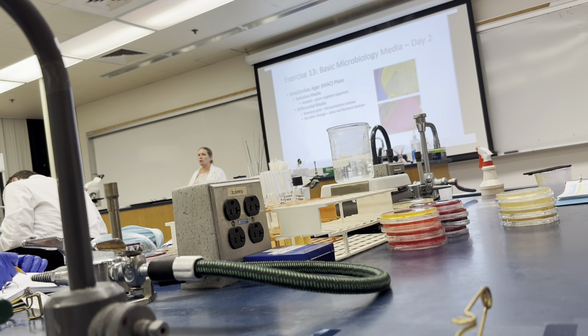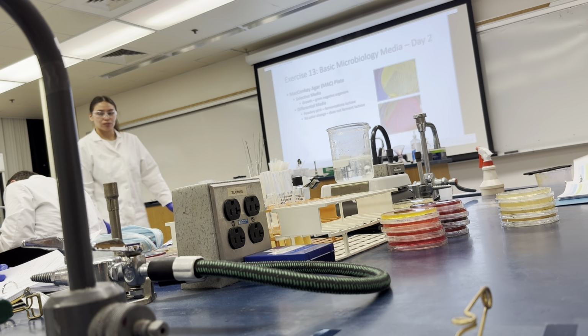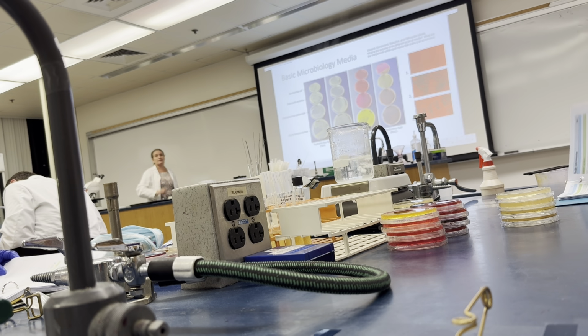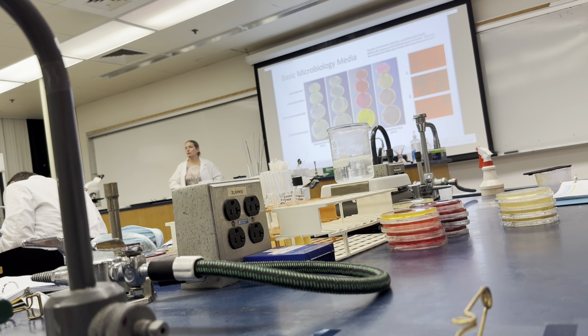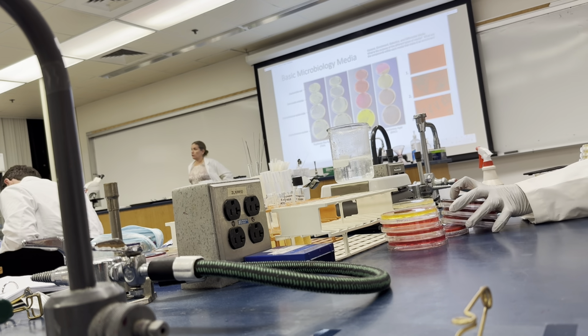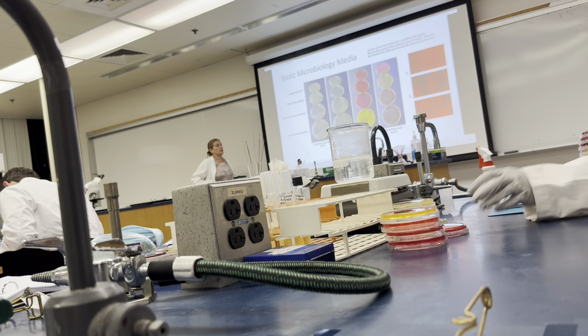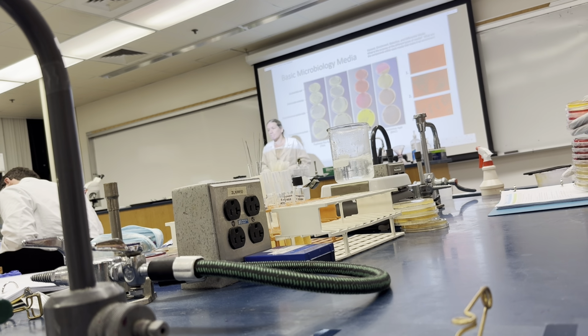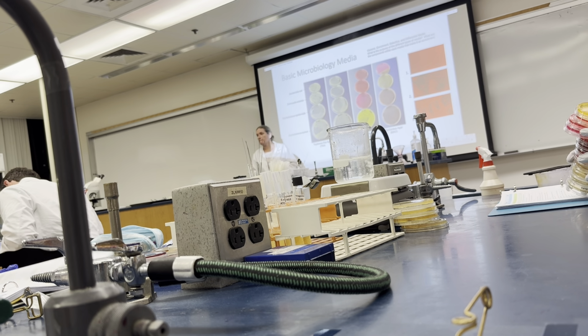All the plates will go into the biohazard bag. Okay? The only slide that I have left while you guys are doing that is just a compilation of what you guys saw. So you have that on Canvas for you to be able to view. That's all the PowerPoint that we have.